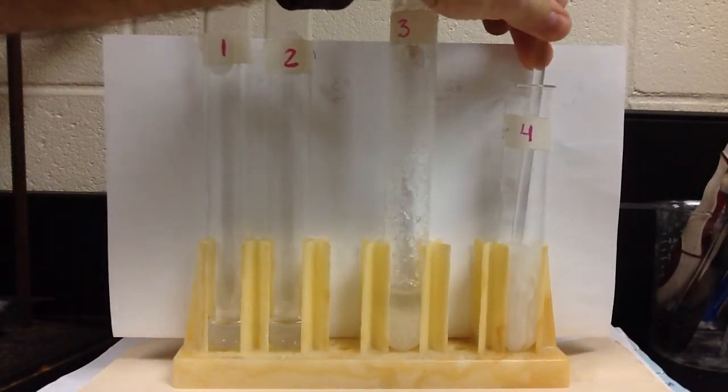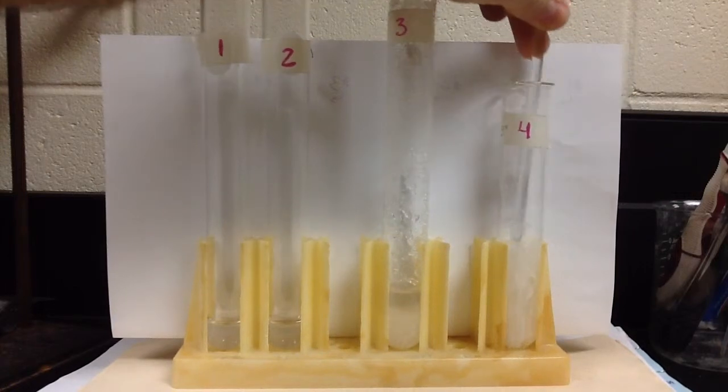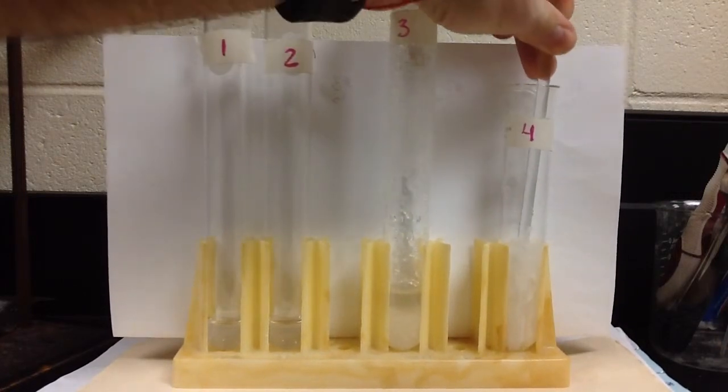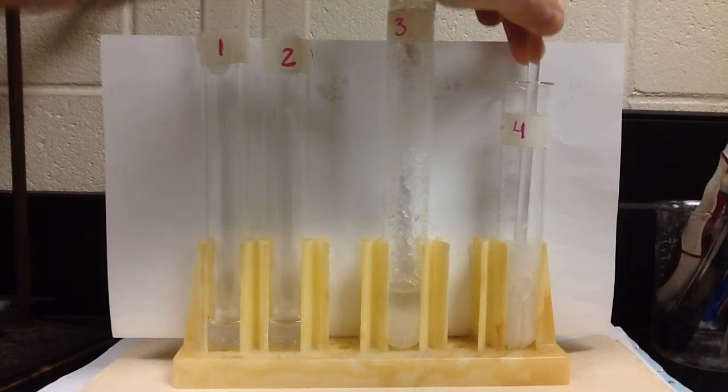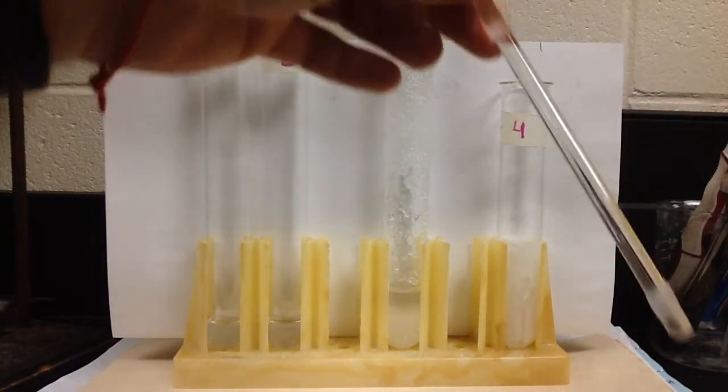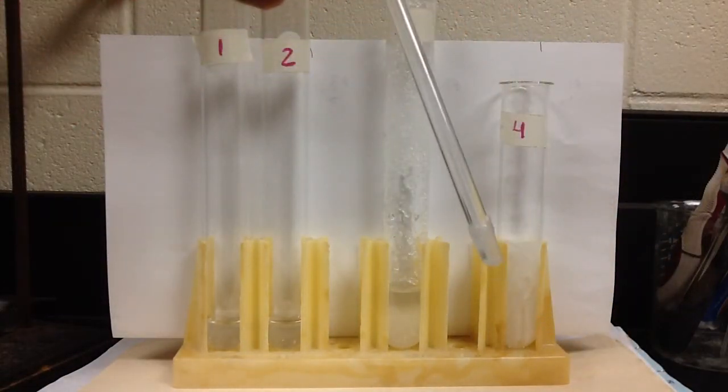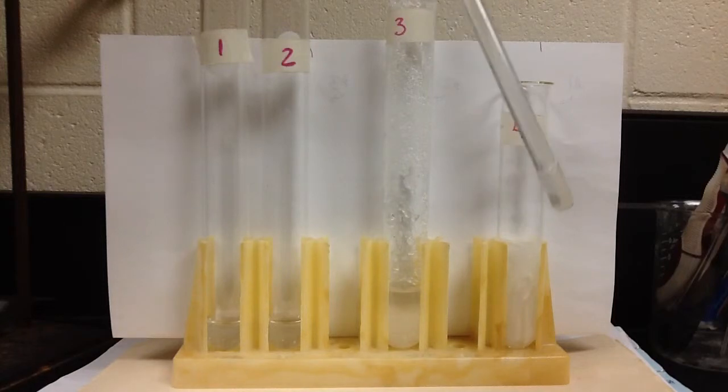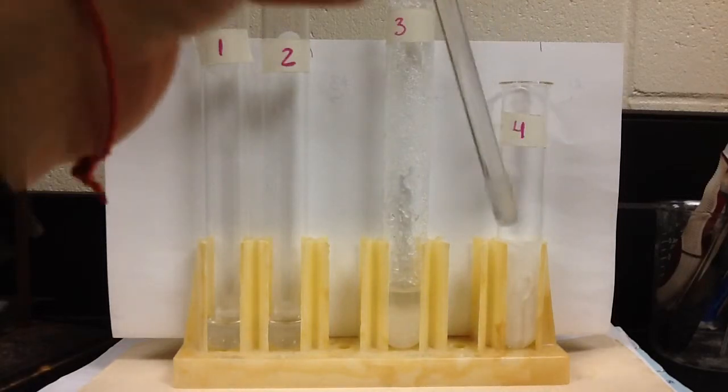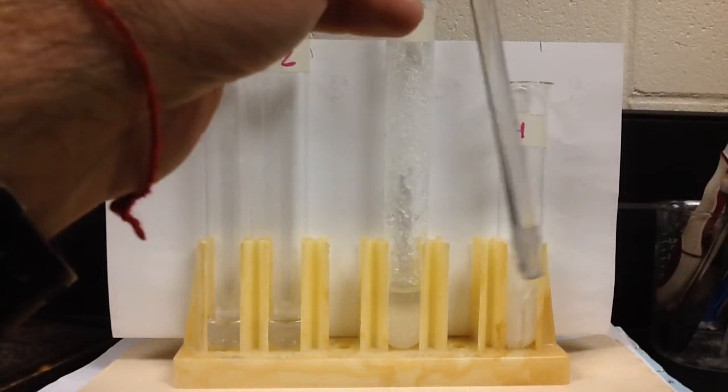You can kind of see them pushing in there. And this is not a solid, this is some of the chemical that kind of came off there. And so we made a supersaturated solution, and by adding the crystal, all that extra stuff came out.